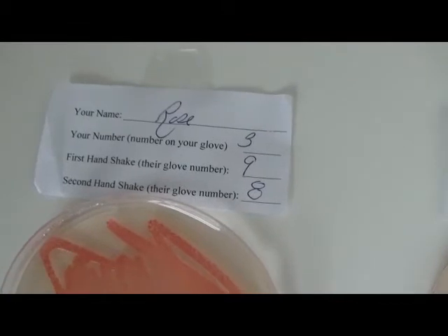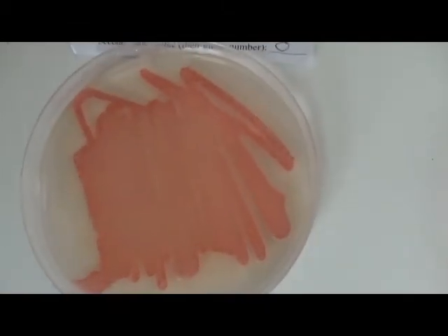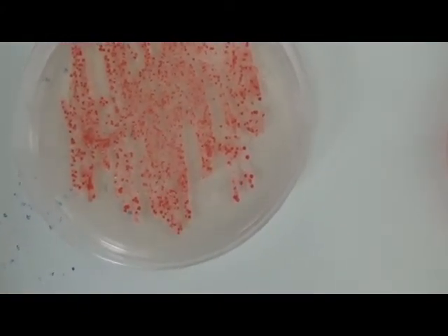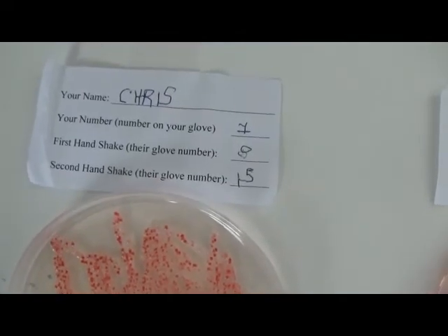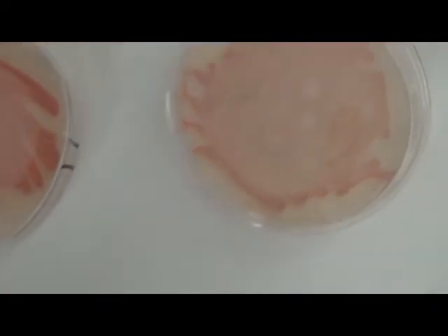Not that this is Rose, but she was probably early on somewhere in the spread because you can barely see any dots there. Whereas Chris down here has a lot more differentiation of dots. There's still quite a thick spread, but it's starting to differentiate a little bit. And so that tells you that he probably contracted it, but got it much later through the grapevine than, say, someone that has a complete lawn where you can't even differentiate.